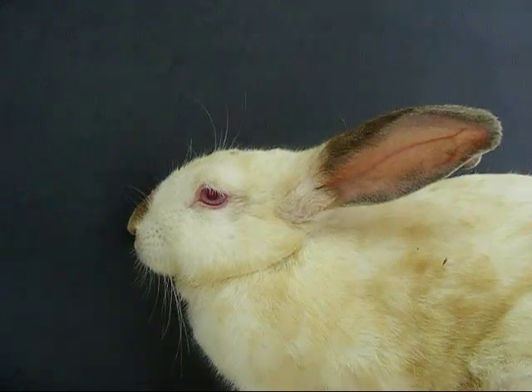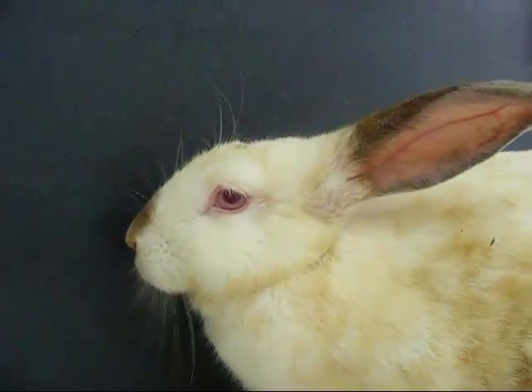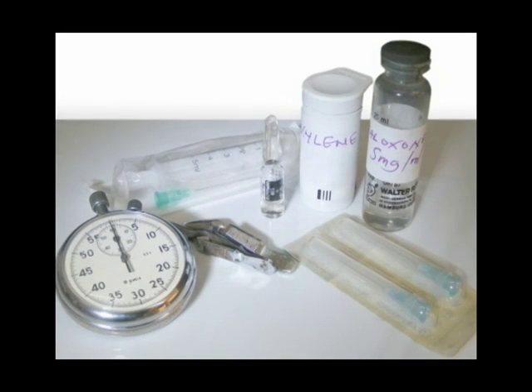This experiment demonstrates the respiratory depressant effect of morphine in rabbits. Respiratory depression is a reduction in the rate of respiration, and it may be induced by some medicines. In determining the depressant effect of morphine, a rabbit is used. This experiment demonstrates both the respiratory and miotic effects of morphine.